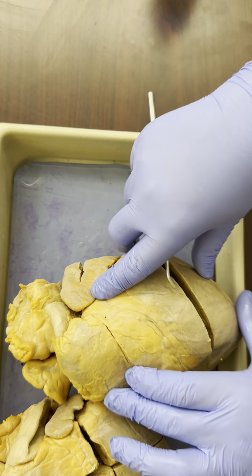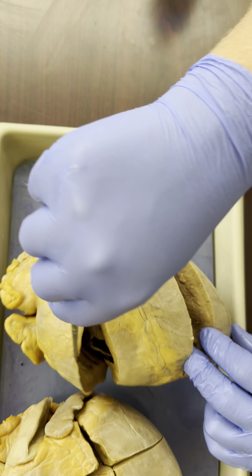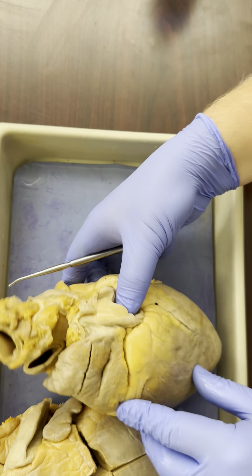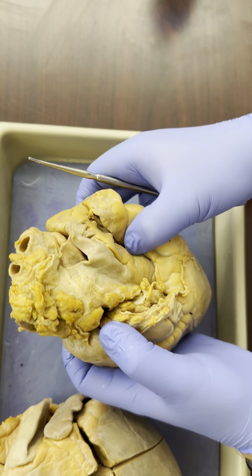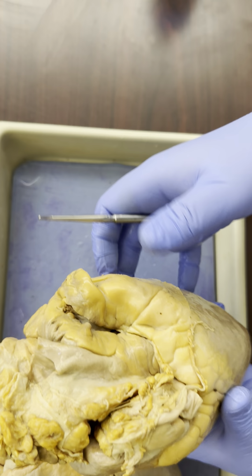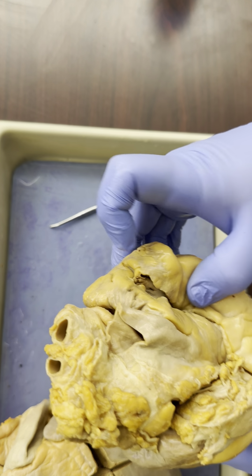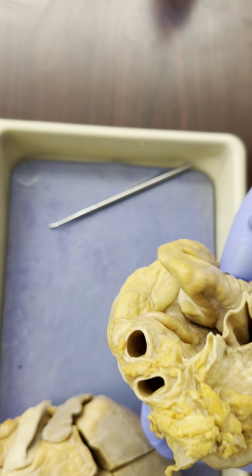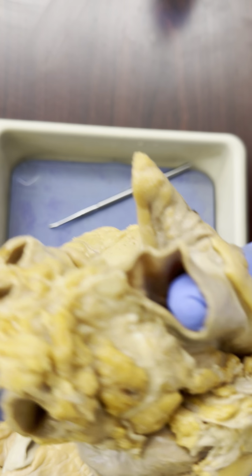All right, so that's everything on the front surface, the anterior surface of the heart, and on the interior of the heart. But let's flip it over and look at the back, the posterior surface of this heart. And it looks like a mess. Don't let it scare you. Here, what you want to do is, again, know your path of blood. That will help identify everything. And then go through and see what's going in and coming out of each of those chambers.